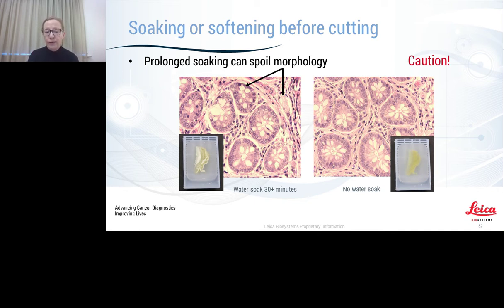Again, you have a morphological change. You can see it in the block, you can see it in the microscope slide, and it's not due to the tissue processing. It's not due to the fixation. It's just simply that a block has been left there a little bit too long and it's caused issues.